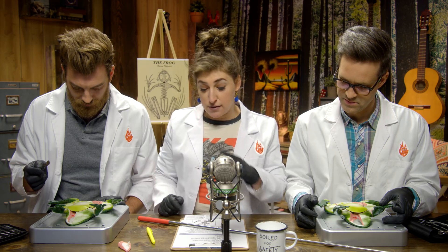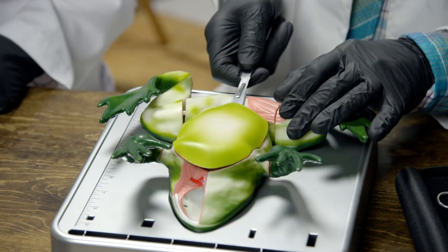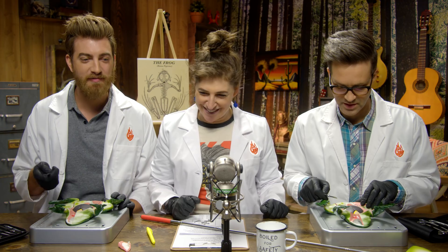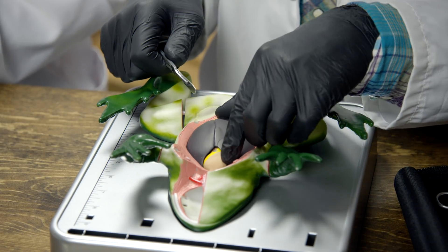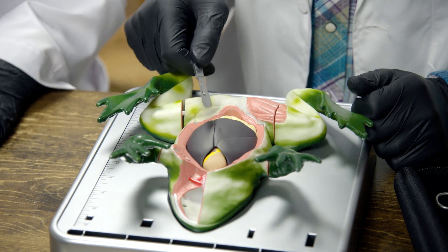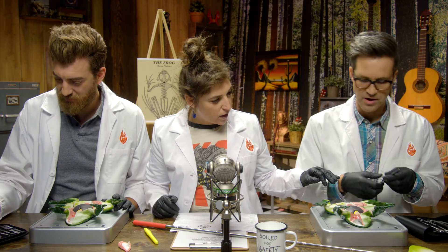We would like to lift and cut through the muscles and the breastbone — remove the panel as it were. Is that how it works on a real frog? Not at all — it pops right off like the hood of an Oldsmobile. Usually on a real frog you'd make more of a T shape and pin the flaps open. There's a lot of blackness in here. Frog's been eating licorice. This is normally the time that you would be able to tell if it was a male or female — there are usually egg sacs and they're quite prominent. That's the liver, I believe.